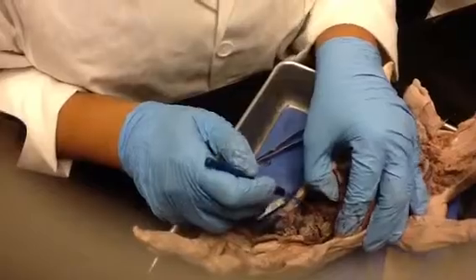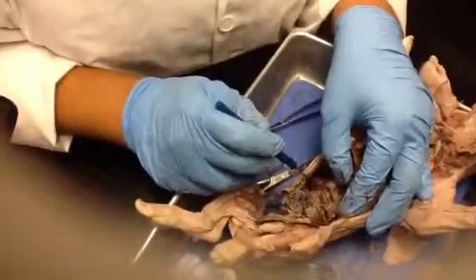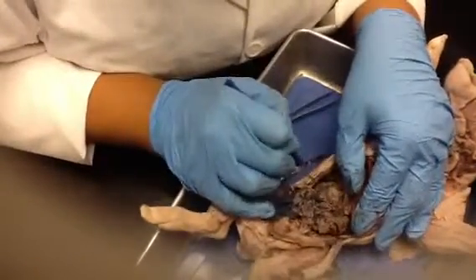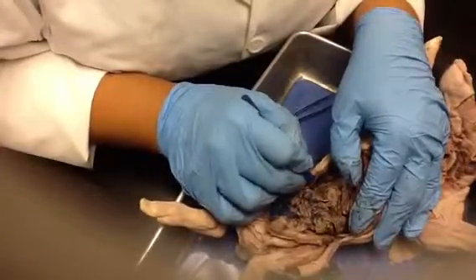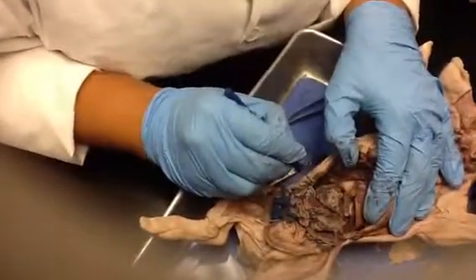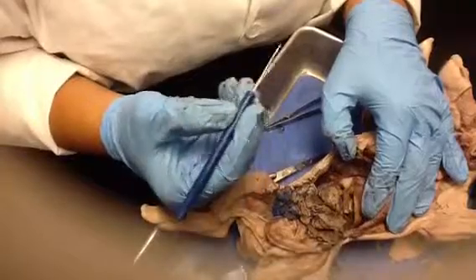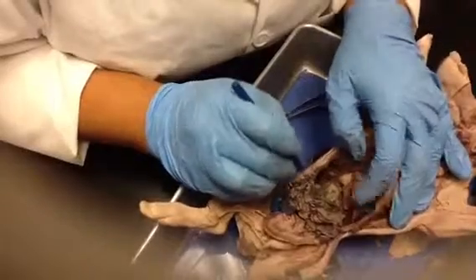We're going to break some of this connective tissue that's right here. Behind that is part of the peritoneum, and behind it is going to be the pancreas. Do you see the pancreas right there? This chunky stuff, the light green stuff. It's not always going to be light green, but in this one it is. Really pretty, actually, in this model. That's the pancreas. Notice, again, glandular tissue, kind of chunky looking, like chewed chicken or chewing gum.